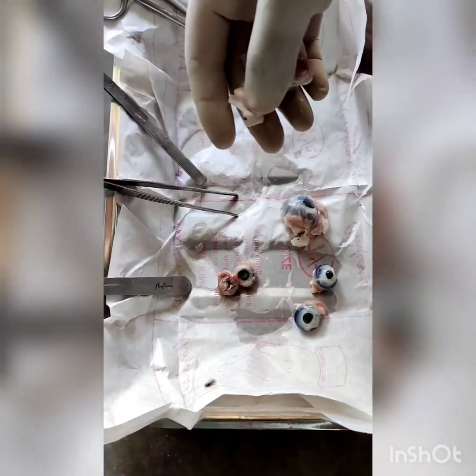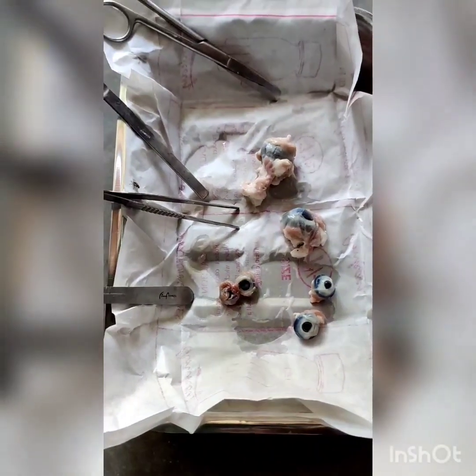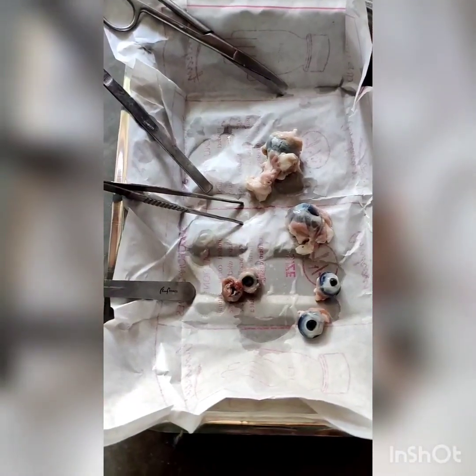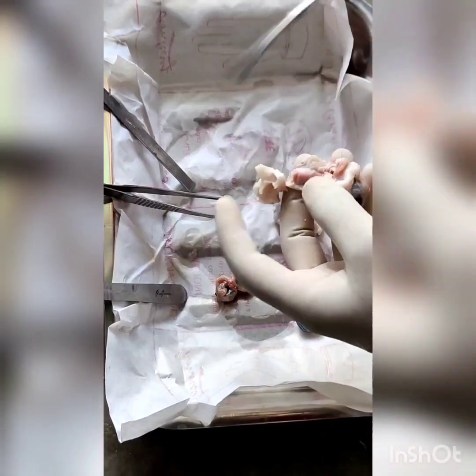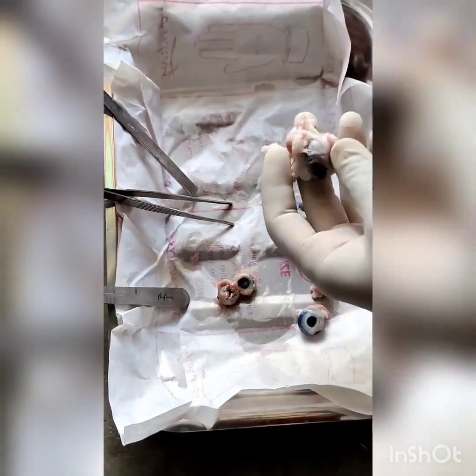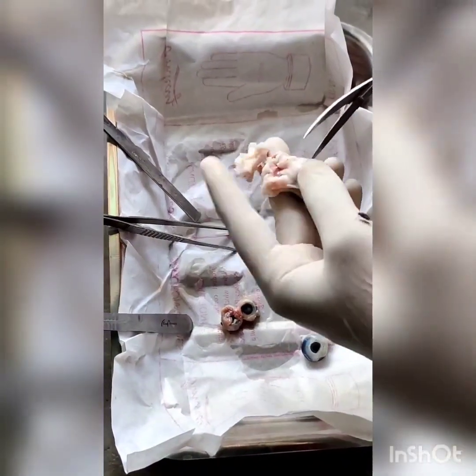After that we have the retina, the aqueous humor, vitreous humor, and the nictitating membrane that is present in birds. This subcutaneous fat around the eye is now visible, and I am going to cut this fat and tear it apart.